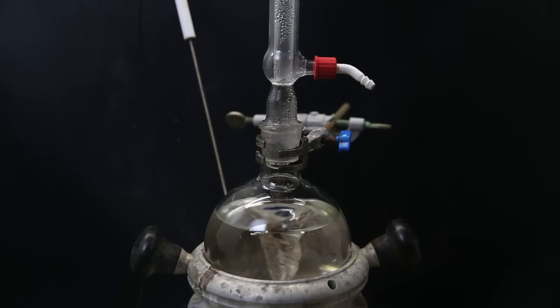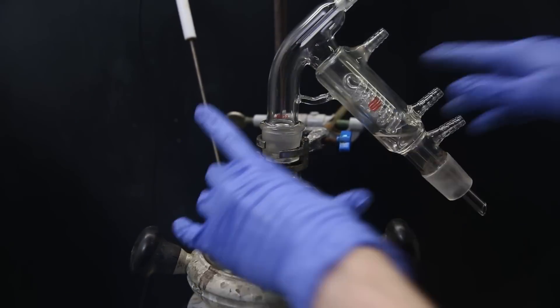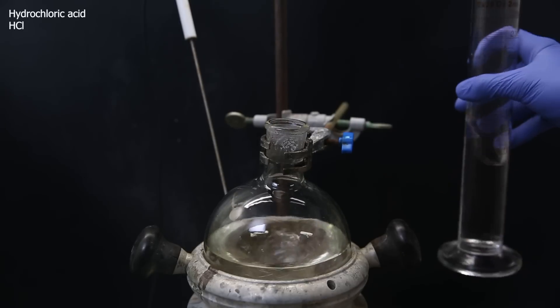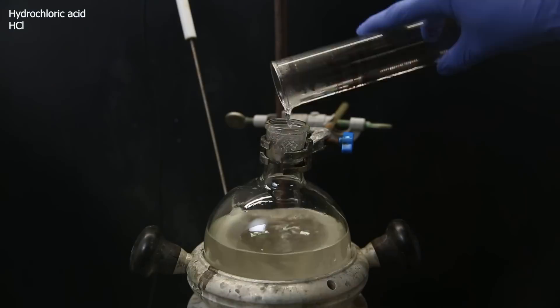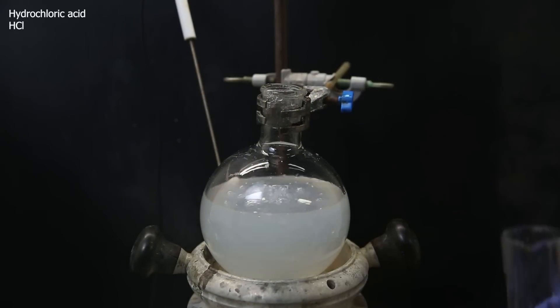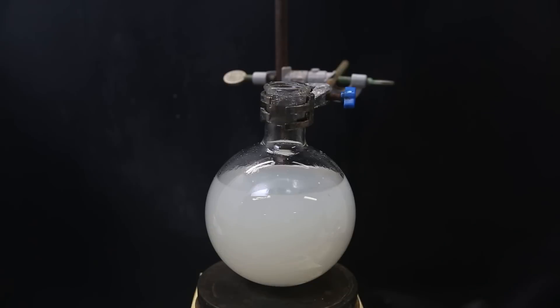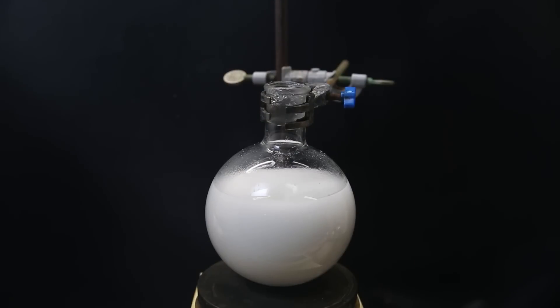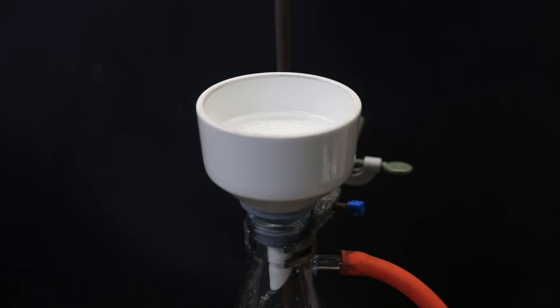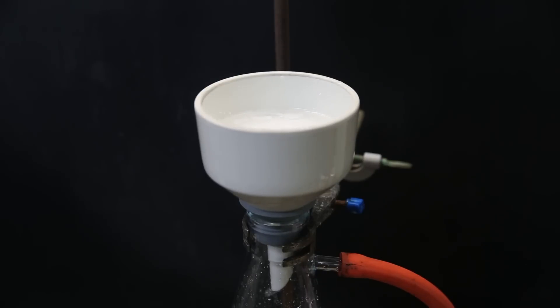When I come back two days later, it is completely transparent, and I replace the condenser with a short-path distillation apparatus and distill off about half of the water. When that's done, I neutralize the excess sodium hydroxide and convert the arsenate salt to its acid form by adding hydrochloric acid, keeping the pH around 2, until a white precipitate of mostly unreacted arsenic trioxide forms. I leave it to cool to room temperature to make more of it precipitate, then filter to remove it. Since the residue is mostly starting material, it can potentially be reused.